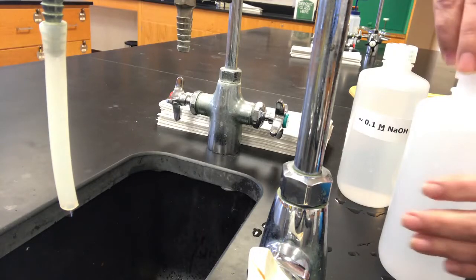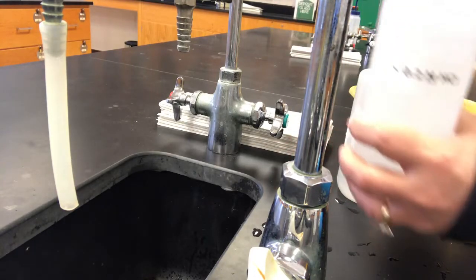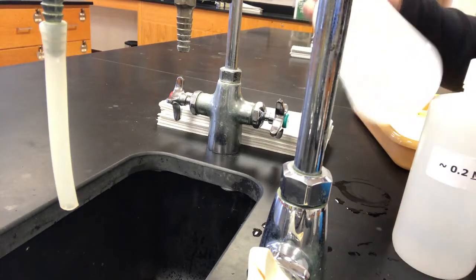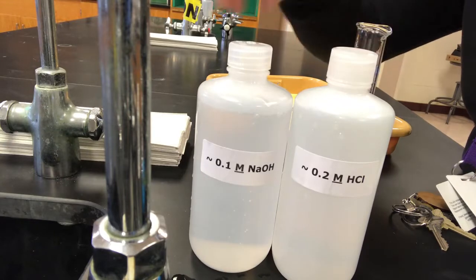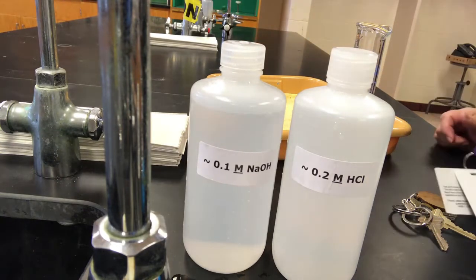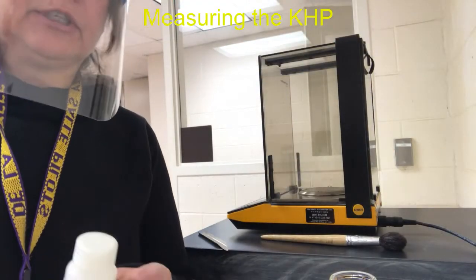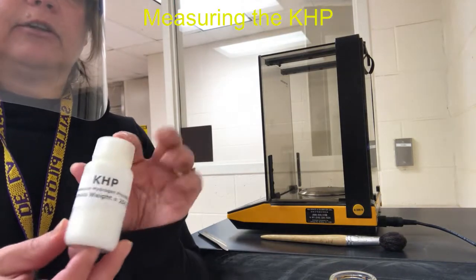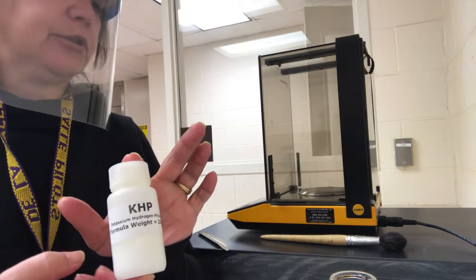Okay, so there's my hydrochloric acid bottle, and here's my sodium hydroxide bottle. So right now the labels say 0.1 and 0.2, but how close are we to actually being 0.1 and 0.2? That's what the next processes in the lab are going to be used to determine. Next, we're going to prepare to standardize our sodium hydroxide to find out how close to 0.1 molar it really is. We're going to use the solid acid KHP to do so.